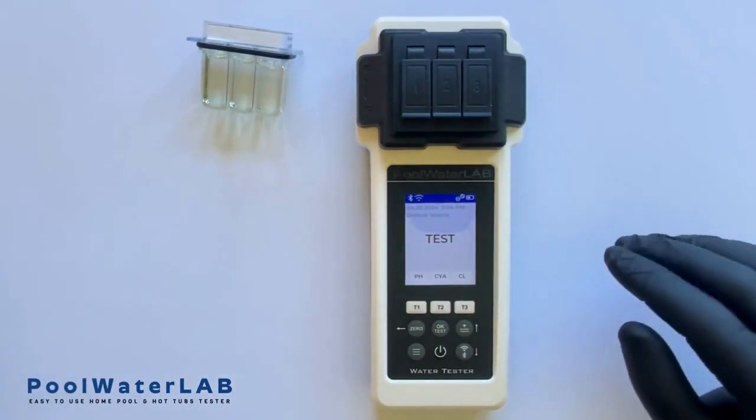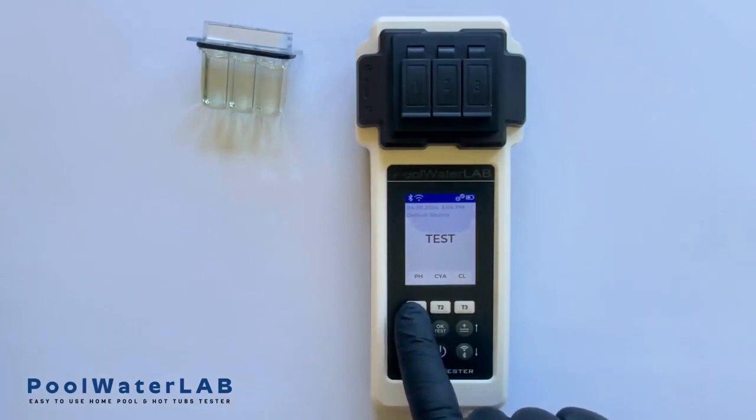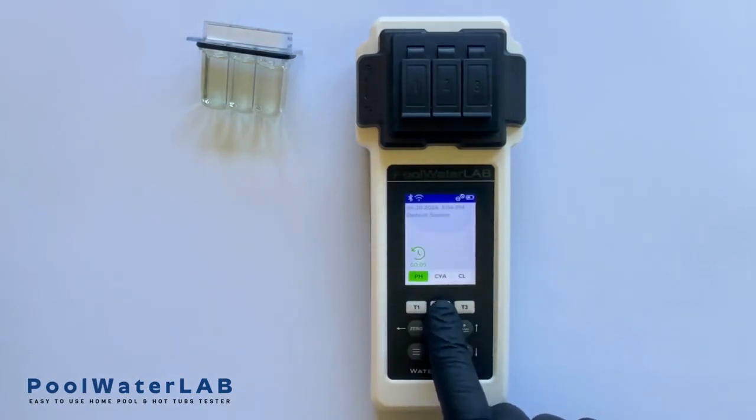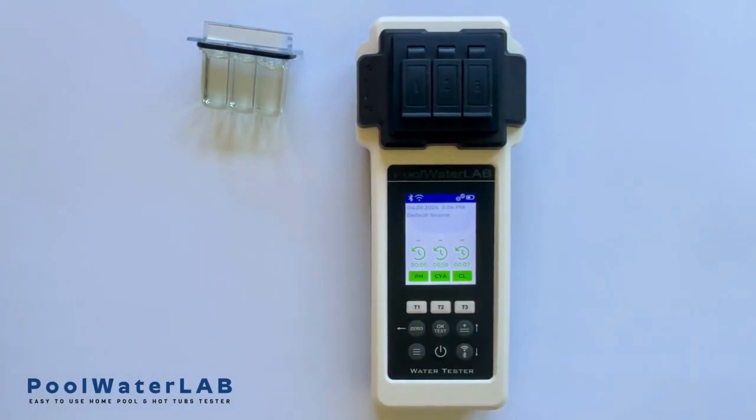Let's start the test. Press the T1, T2, T3 buttons to begin testing. Press OK. Please wait until the countdown ends. This process may take some time, but it is essential for ensuring the accuracy of the test results. The test is complete.